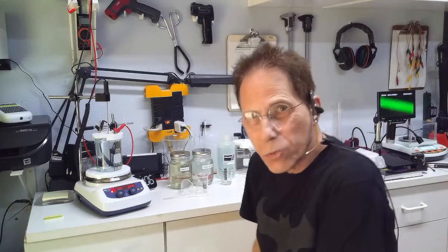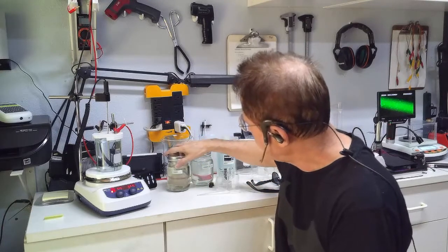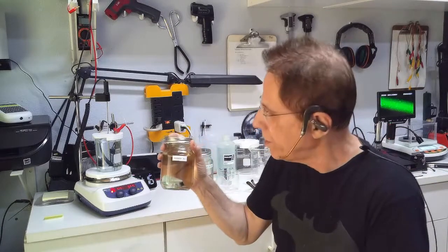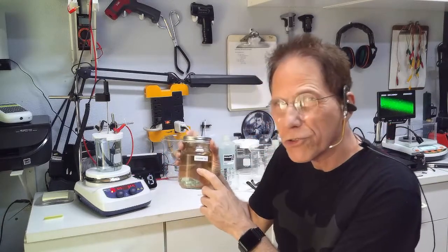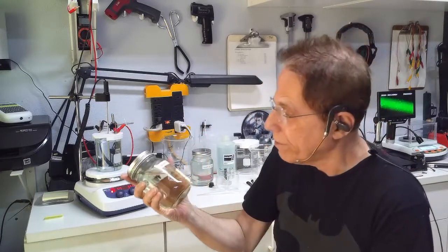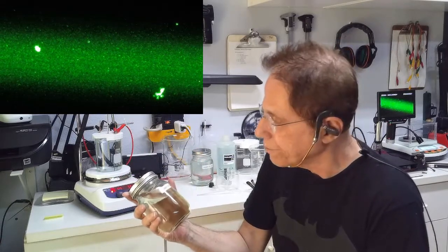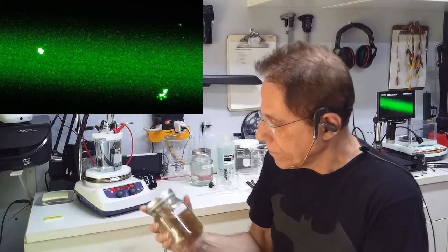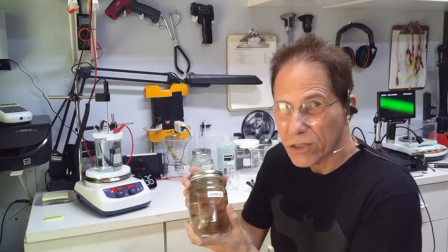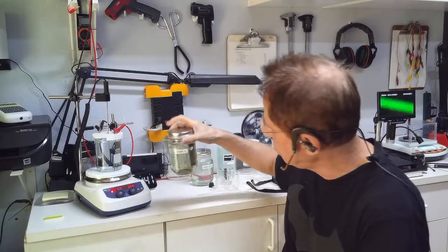So last week I cooked up different processes. Call this copper citric, sodium citrate. They use sodium citrate to cook this up. Now, this looks like brown copper, which is pretty much amazing to me because this was green copper when it was done. Now, several days later, I cooked this on Thursday or Friday, and now it's Tuesday, so 5 or 6 days this has sat and it's turned into brown copper.